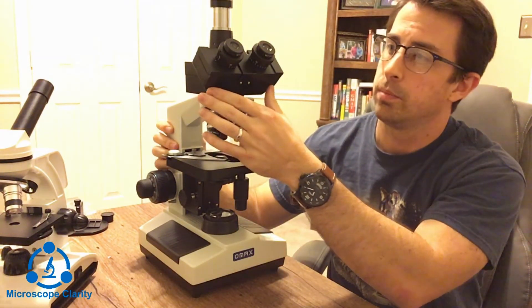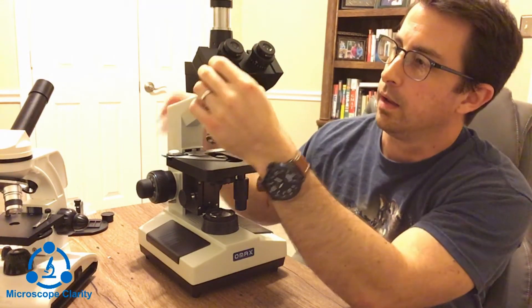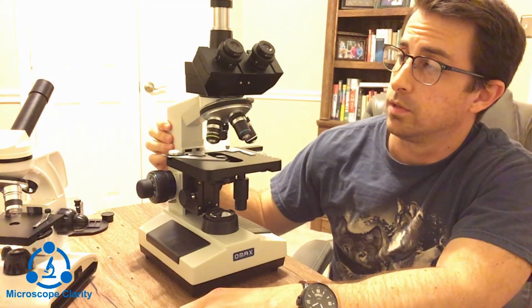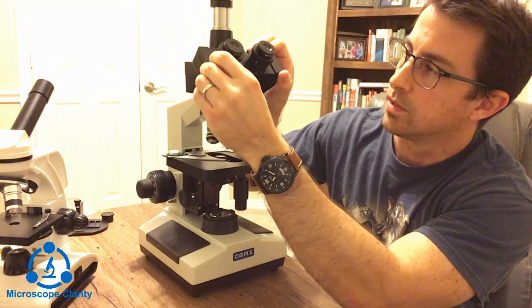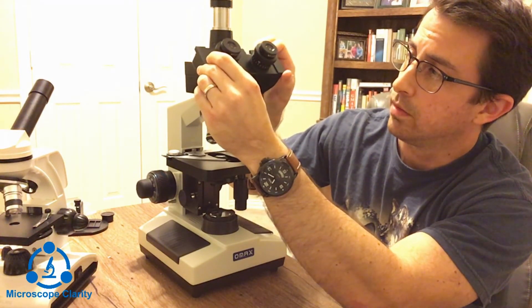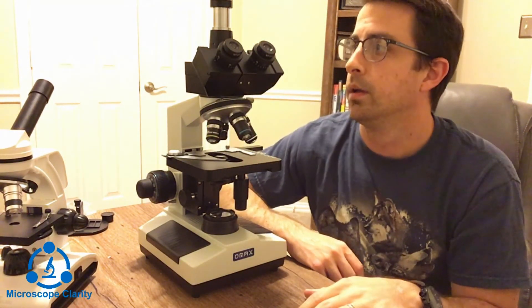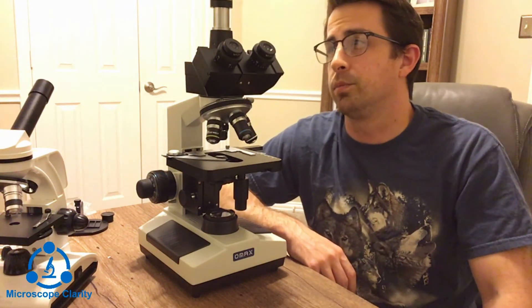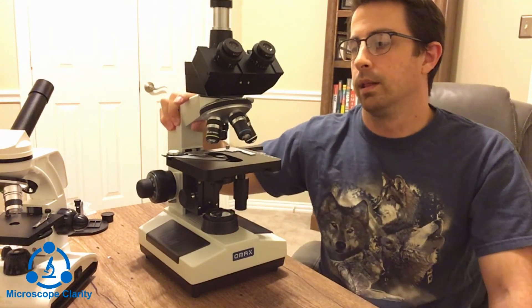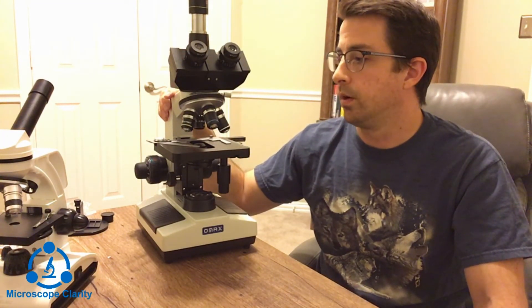We've got the body of the microscope, and this one has two eyepieces — the same idea, they fit into the eyepiece tube. Since it's a binocular microscope, it has an interpupillary width adjustment so you can adjust for eyes that are farther apart or closer together. We've also got a trinocular attachment on top, which allows you to mount a camera and take video and photos of the specimens you're looking at.